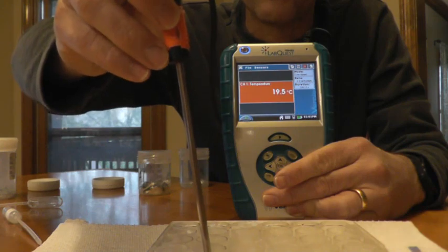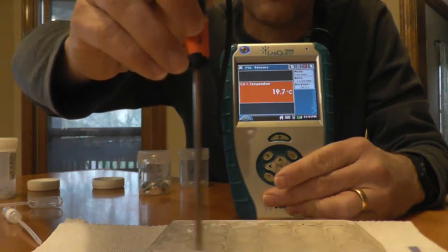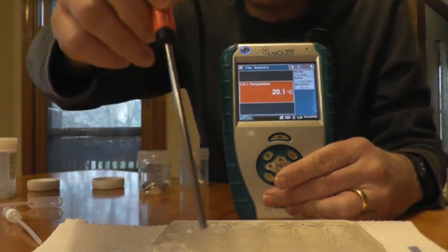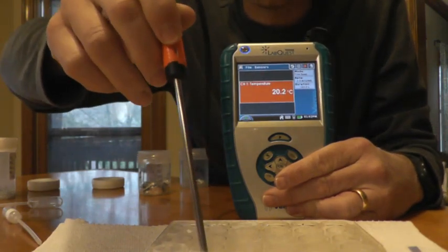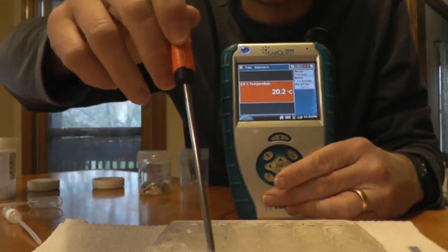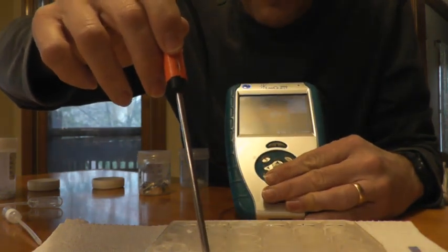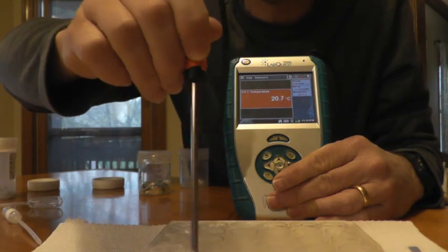If you remember back to probably September, you had that challenge where you had to figure out how much gas you could produce. This is how we produced it. We used magnesium and hydrochloric acid back in the gas laws unit. So this is already up to 20.5.